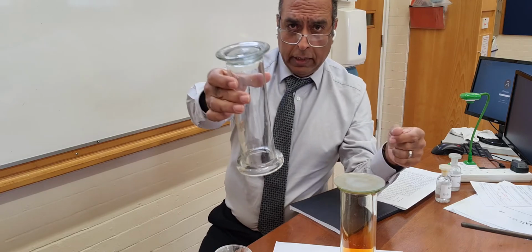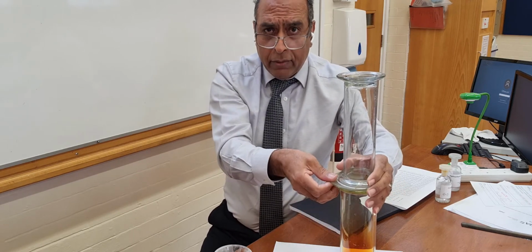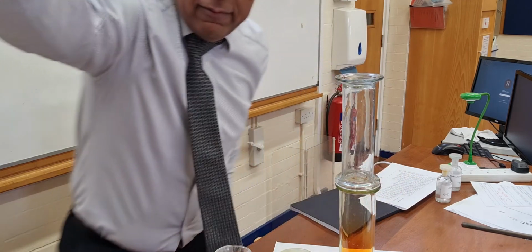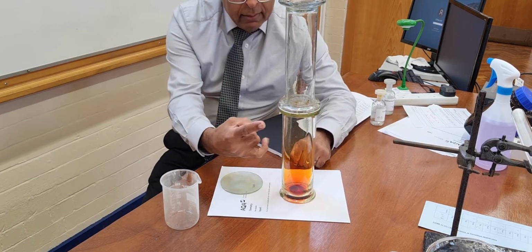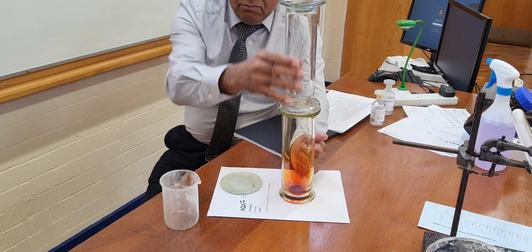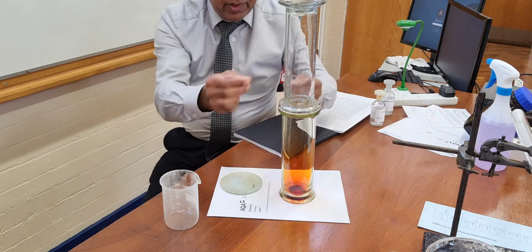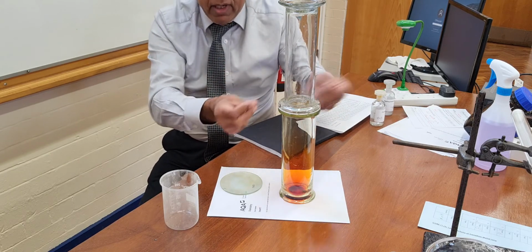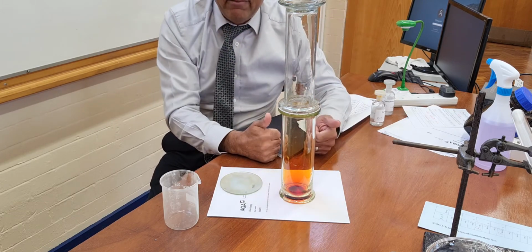the top gas jar, this is the empty side, I'm going to put it upside down over that one. I'm going to pull out the cover slip, and there we've got the two gases. Maybe if I change the camera angle a bit, you can see here I've got bromine here as a brown gas. I've got air in this as a colourless mixture, and what will happen is that the random movement of these particles will be such that the brown particles will knock against the air particles, and the randomness of the motion will mean that some of the browny colour ends up in the air above.